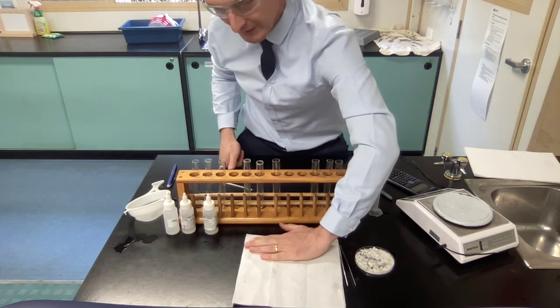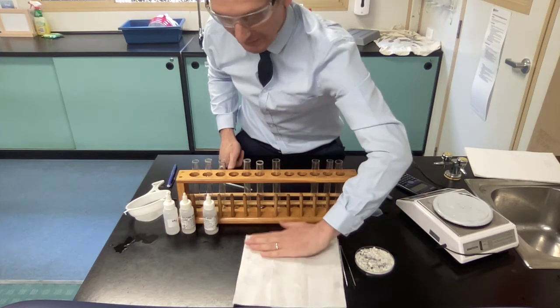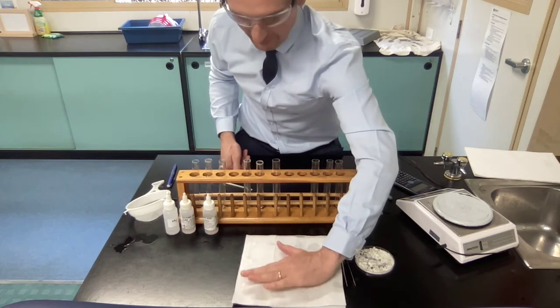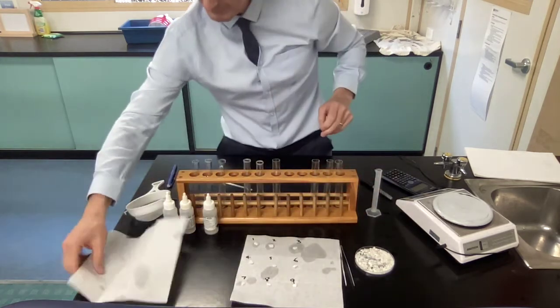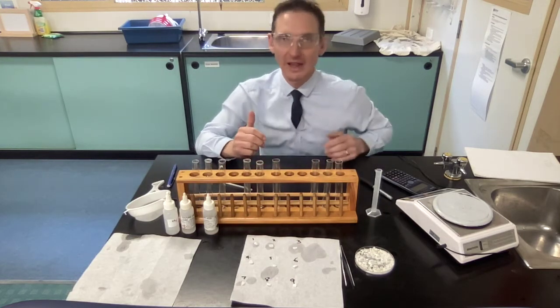If we have water on these, we really should dry them out for a long time, overnight or just in the incubator or just a hairdryer or something, but we just don't have that time. So we just want to wait a couple of minutes and let them dry off. We don't want to add weight to them, add mass to them, but if we're not careful, we will keep them wet and then we will have added water.